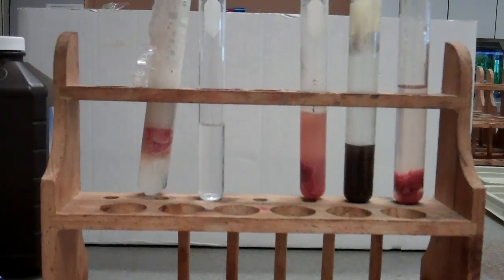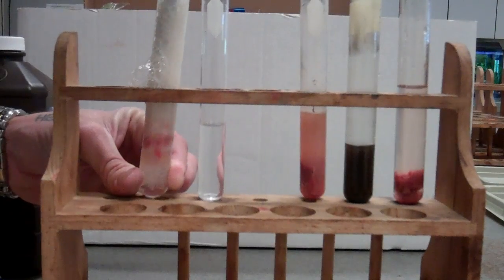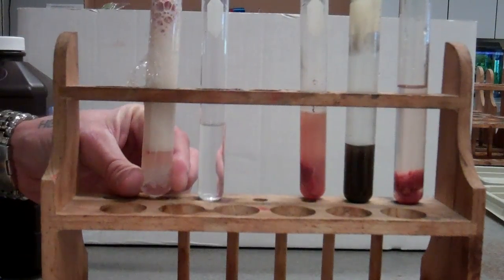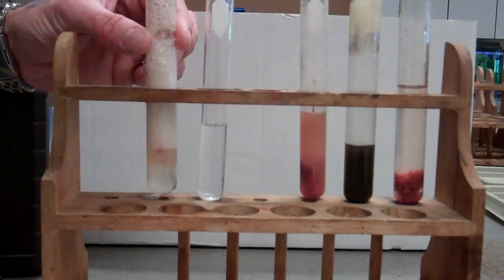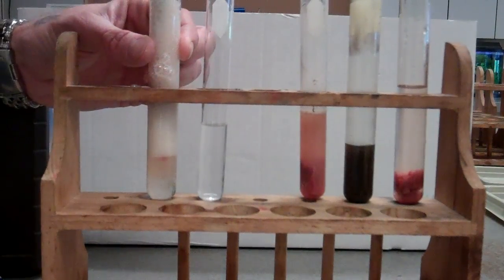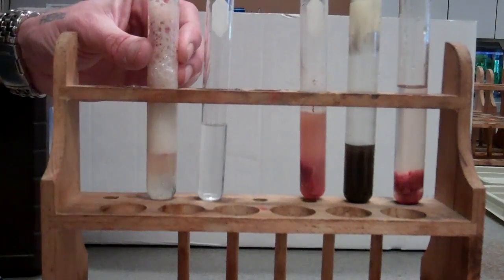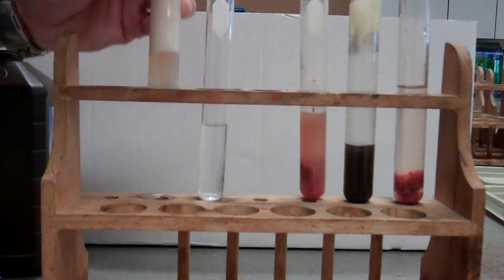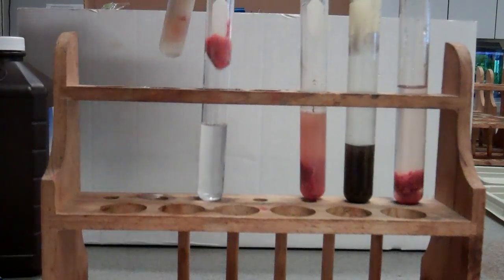And then I can get this liver out of here, hopefully. And I can put it into my next test tube. This piece of liver is not very good. Okay, I can put it into the next test tube.